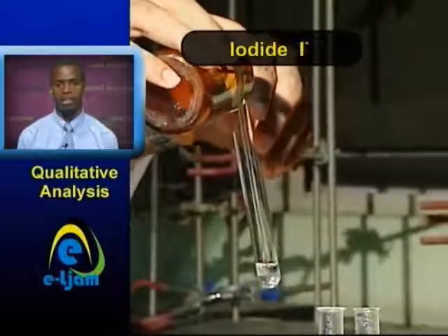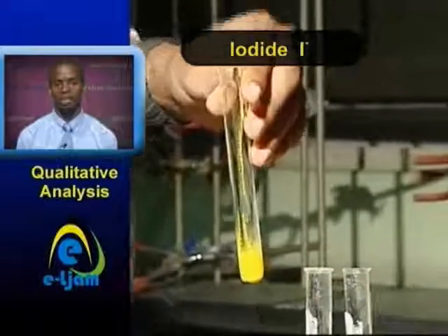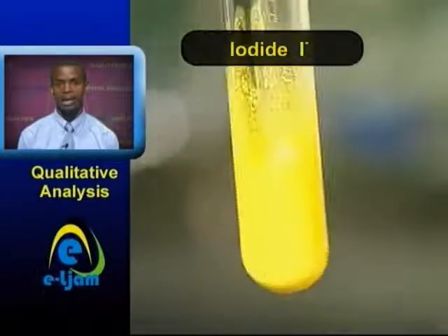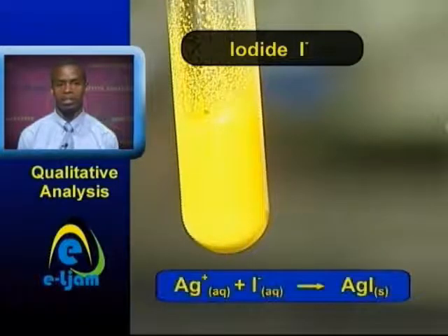Iodide. This precipitates from solution as yellow silver iodide on addition of silver nitrate solution. The precipitate is insoluble in dilute nitric and sulfuric acid and almost insoluble in concentrated ammonia solution. The solid decomposes with evolution of iodine when treated with concentrated sulfuric acid and warmed.